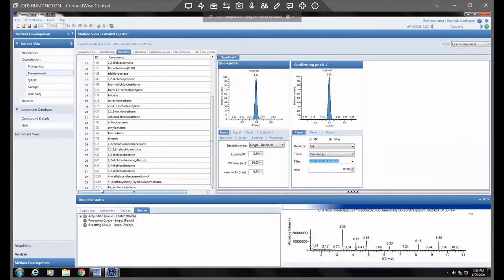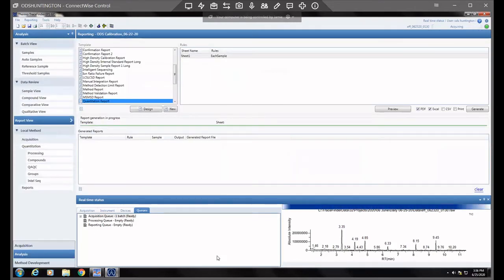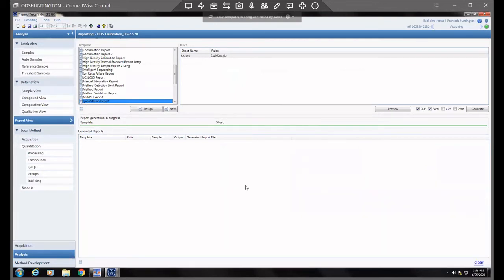And now you see 10.67 here. We have to make sure we save that, because if we don't, it will not save it to the actual method. So just go up to the top, save master method, and that should have saved it. Then when we go back to analysis, sorry, ignore that. She's running currently, so we can just close out of that. That's irrelevant to what we're doing.